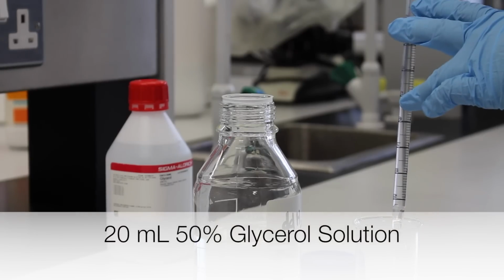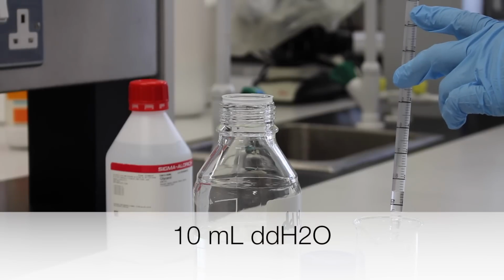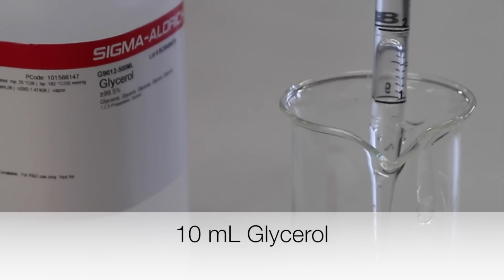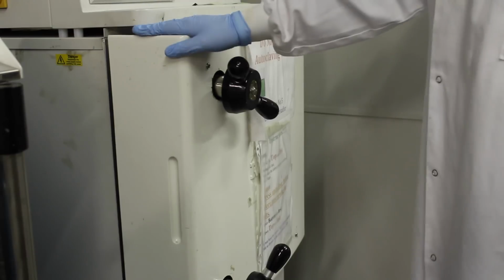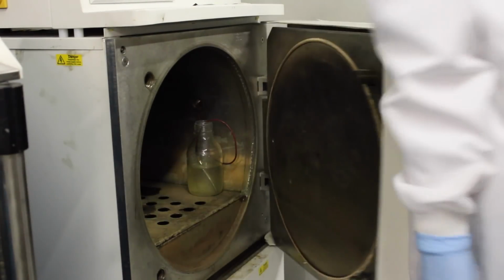In this example, 20 milliliters of 50% glycerol solution is made by adding 10 milliliters of water to a beaker. 10 milliliters of glycerol is then added to the water. The solution is then covered with aluminium foil and autoclaved for 20 minutes. A 50% glycerol solution has now been made.